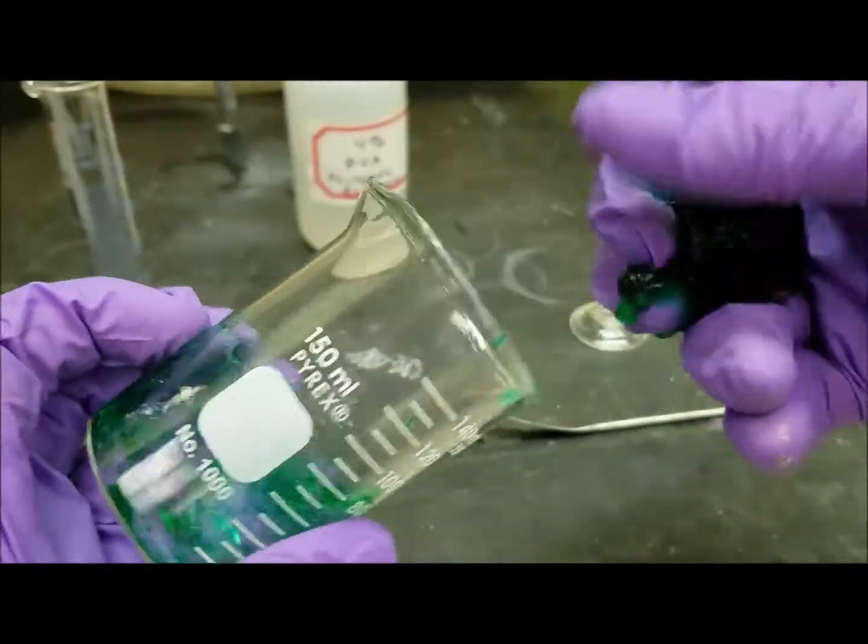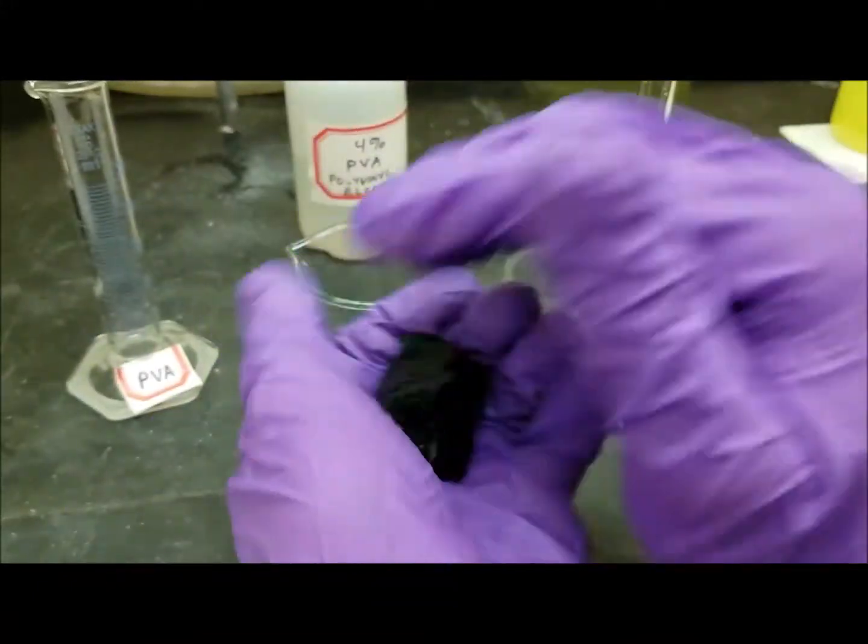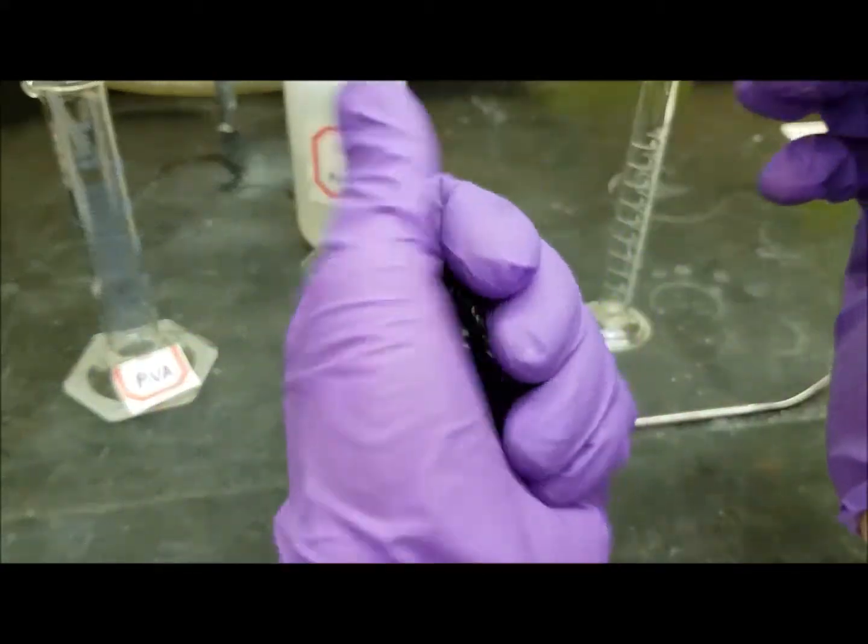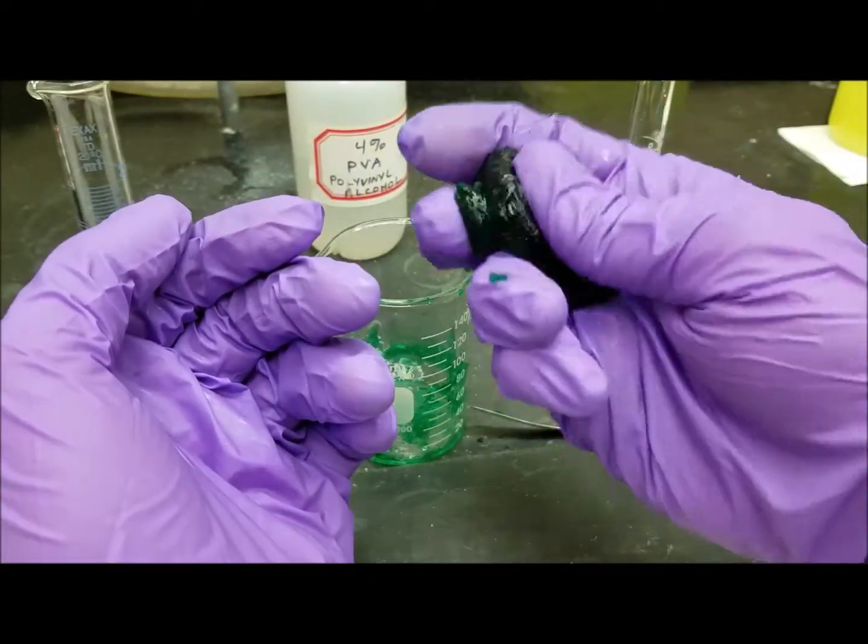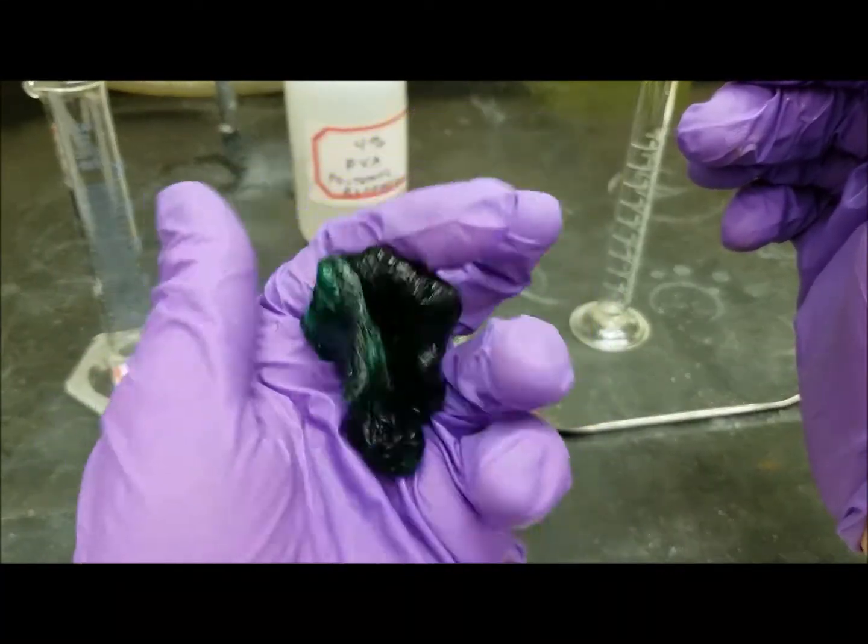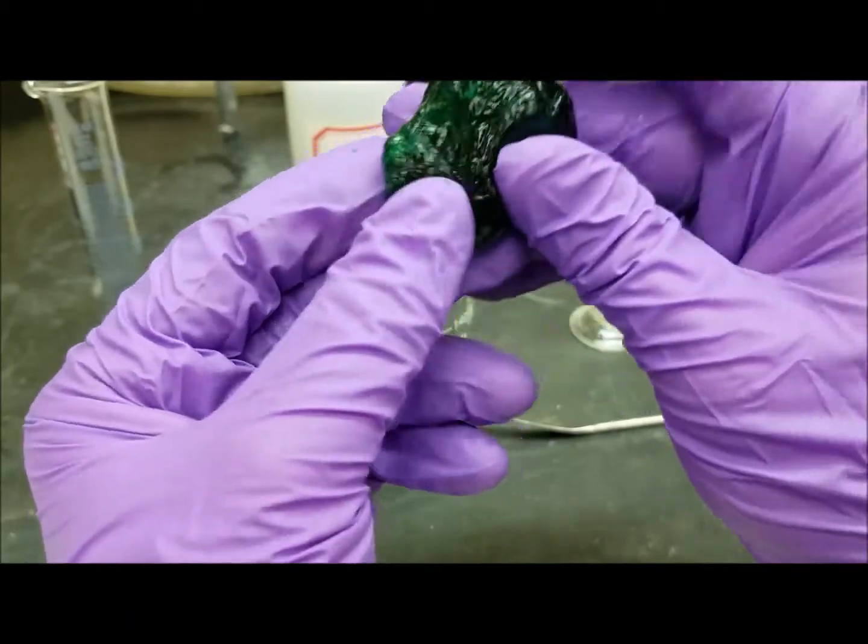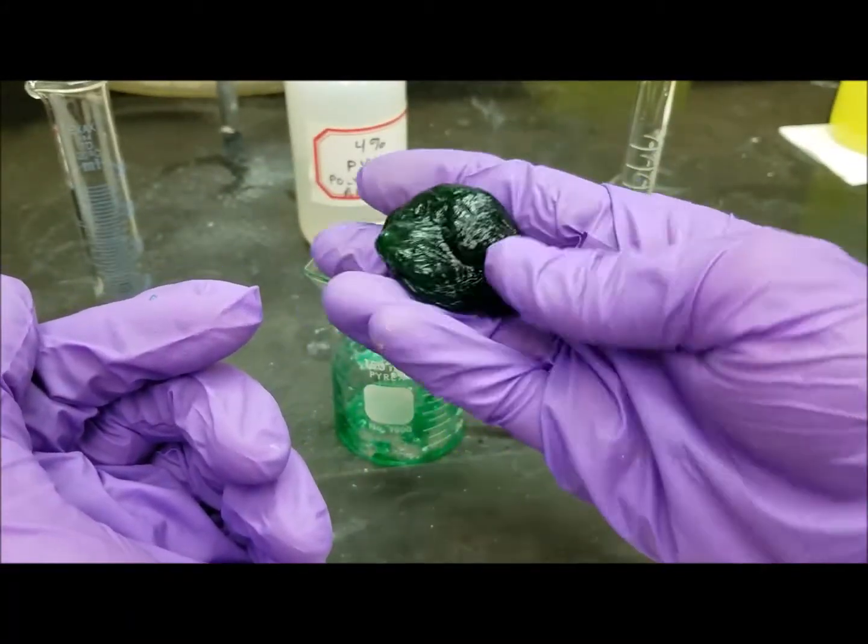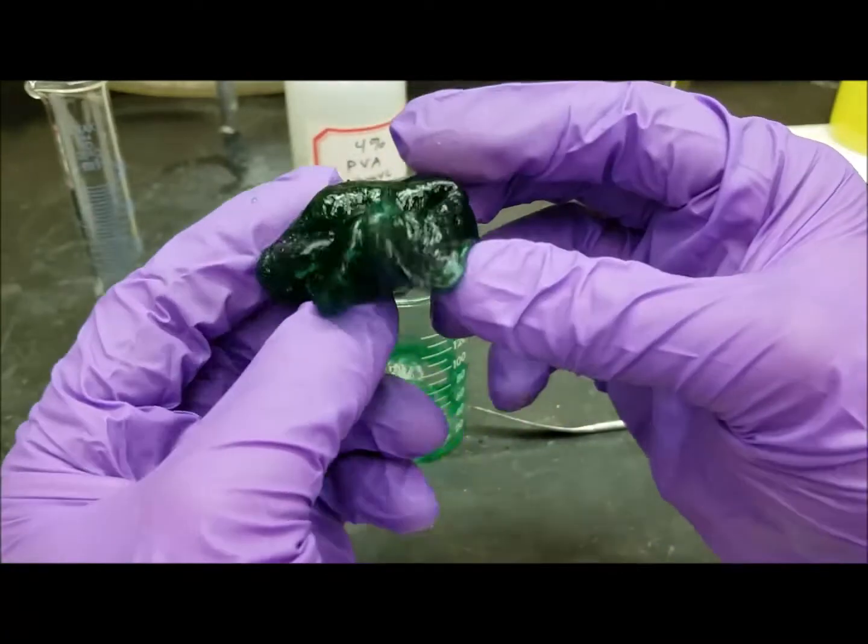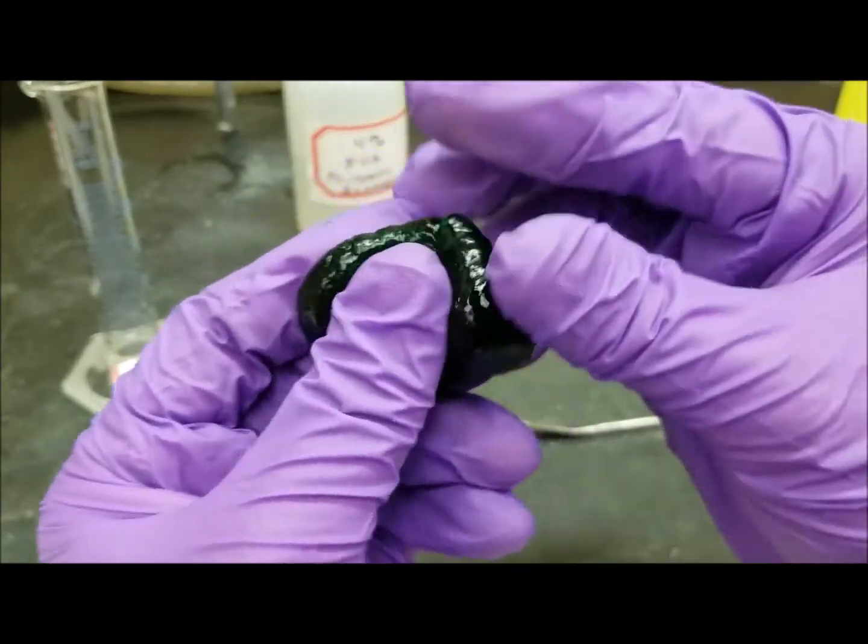And this is actually a hydrogel because there's a bunch of water stuck in here too. So we're supposed to knead this until it's no longer sticky. It doesn't actually feel very sticky right now. Now if I were to leave this sitting out, the water would evaporate and this would probably harden into a pretty plastic-like substance. But there we go. So that is slime, this is cross-linked polyvinyl alcohol.